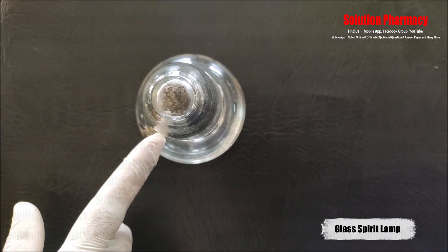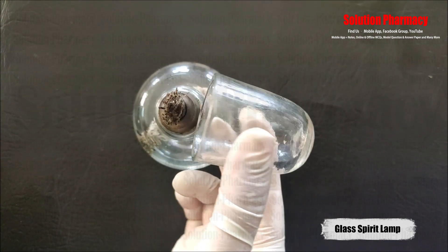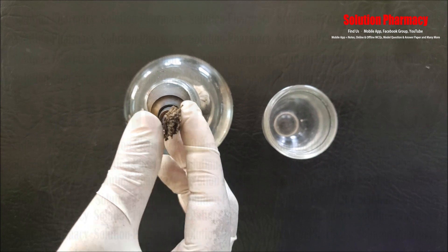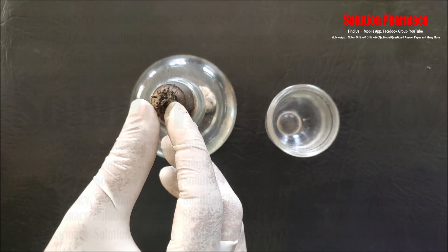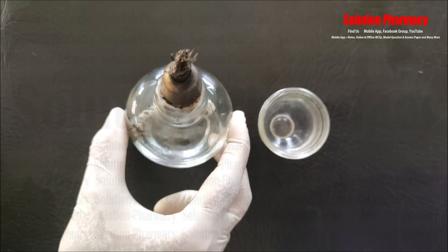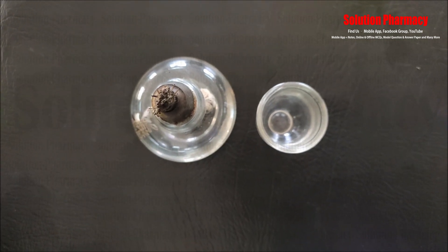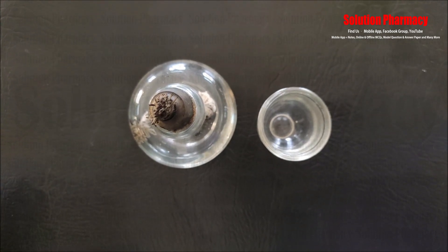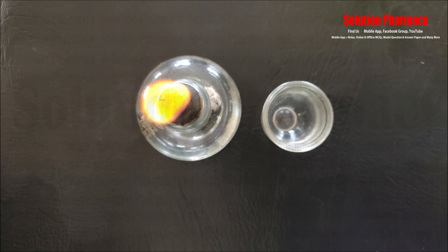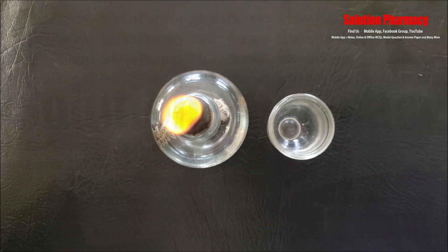Next, this is called a glass spirit lamp, used for different heating purposes when an open flame is required. It has a glass cover, a wick, and a metal screw that supports the wick. The vessel is filled with spirit, and the other end of the wick is completely dipped inside the spirit so that by capillary action the spirit moves upward to the top of the wick. With the help of a match or lighter, we can light the lamp.